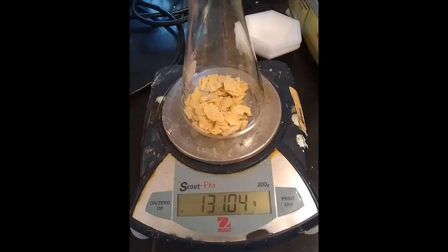And that is the amount of lipids collected. You can also look at the weight of the original Erlenmeyer flask plus the weight of the chips. Take that total weight minus the weight of the chips once all the lipids were extracted from them, which is 131.04 grams. So the weight of the empty Erlenmeyer flask plus the weight of the chips, add those two together and subtract 131.04 grams, and that will give you the mass of lipids taken from the chips. So you can then compare those two values and assess the amount of lipids recovered.